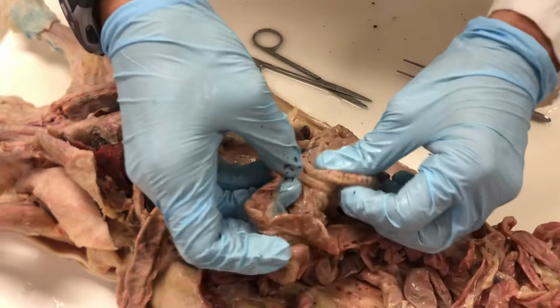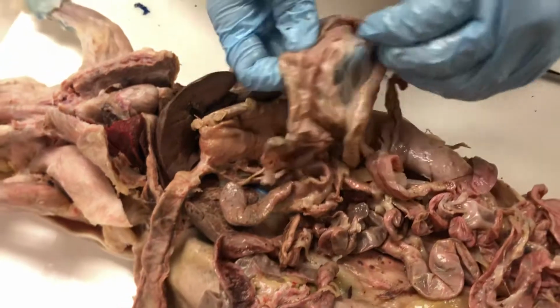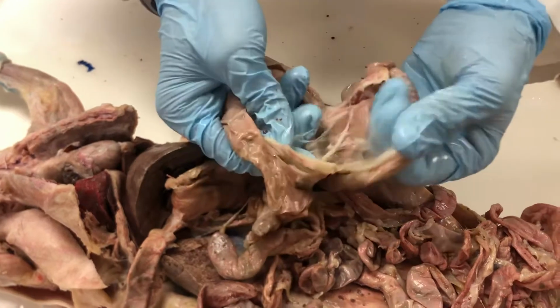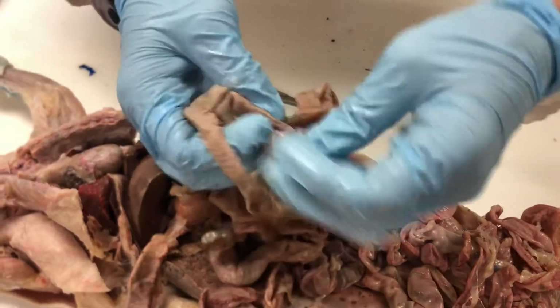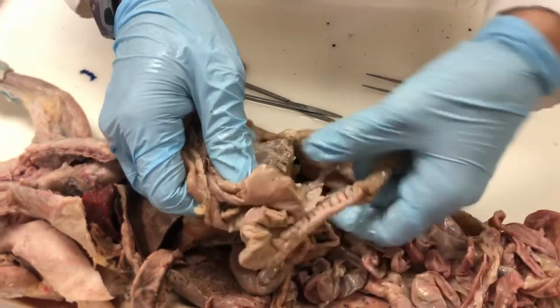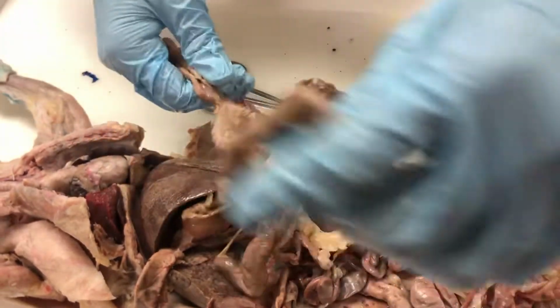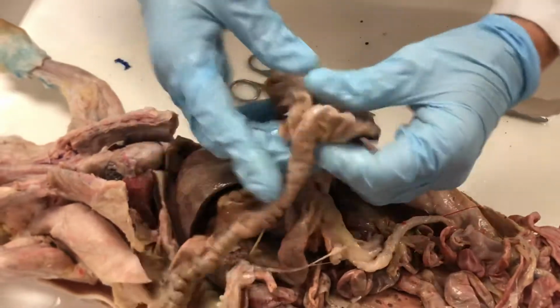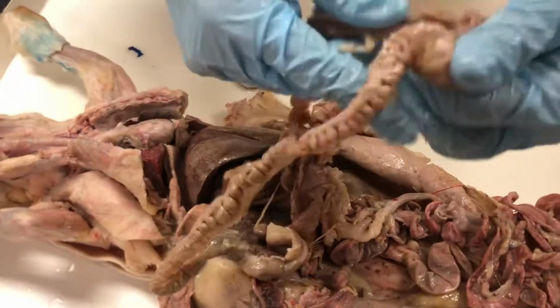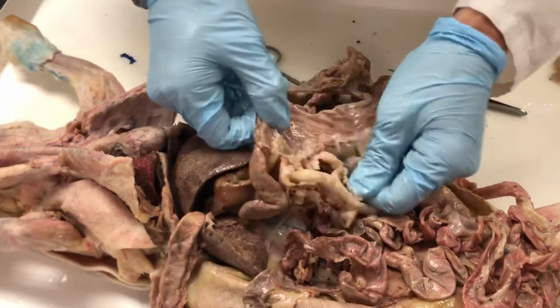Okay, I'm getting into our connection point where our small intestine is going to end into the cecum as well as the large intestine. Bear with me. The cecum in a human is a quite short little pouch at the end of the small intestines. But in a rabbit, because of their diet, they have a very large cecum to allow for more time and more fermentation of all that food to get all the nutrients out. Yeah, this is quite the fun tangle of intestines.